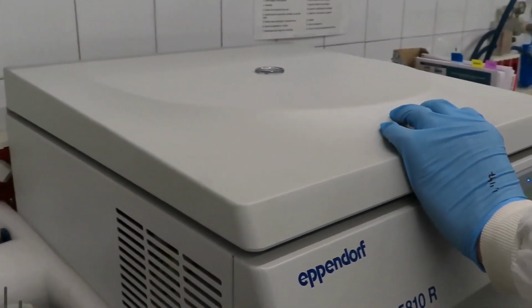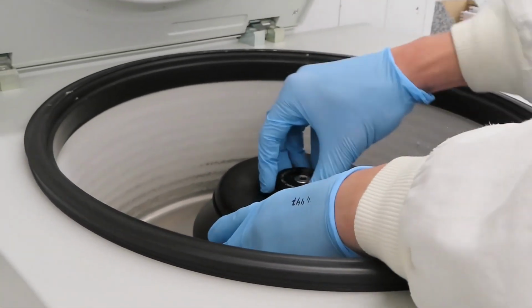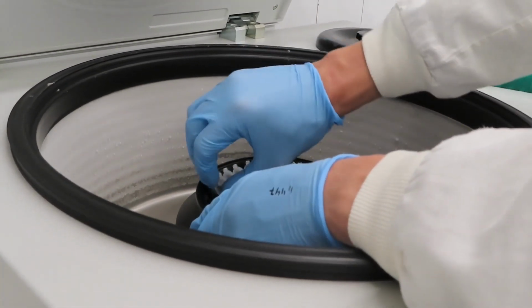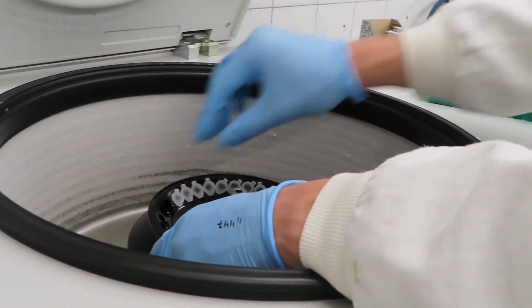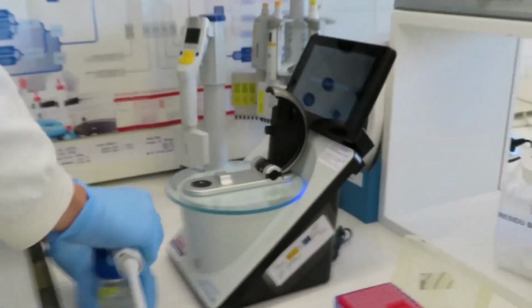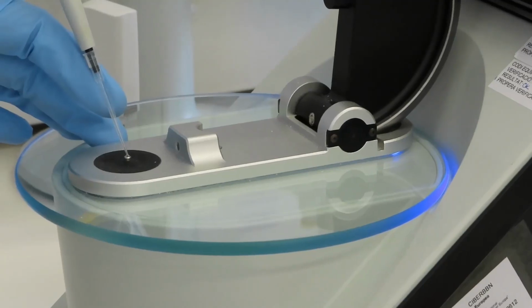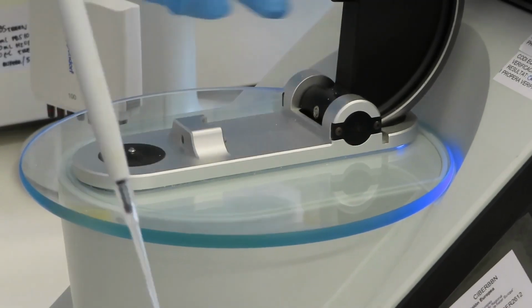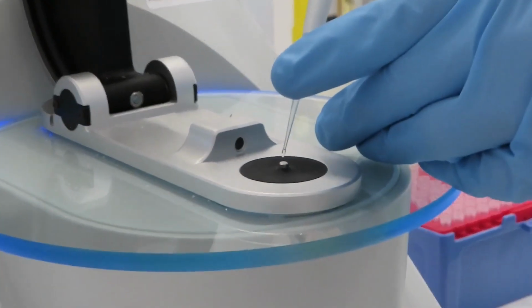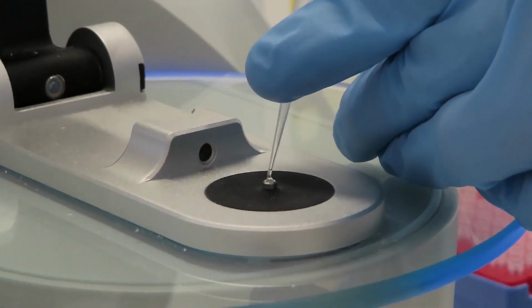After the centrifugation steps, all the supernatant of the protein samples will be transferred to a new Eppendorf tube to eliminate the pellets, which contain the protein that has been aggregated during the process. Finally, the amount of protein that remains in the supernatant can be measured in a spectrophotometer at 280 nanometers, provided that the signal of each of the buffers is subtracted prior to the reading of the protein samples.